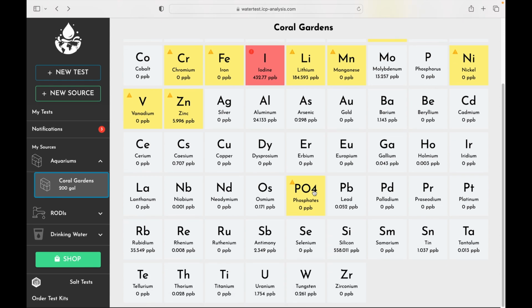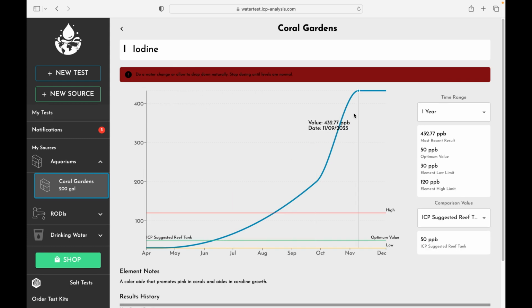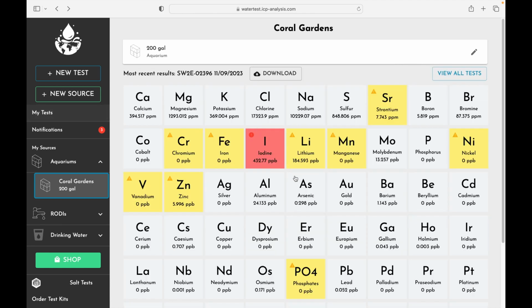So overall, not a bad test, except this iodine here would concern me, and there's something going on here. This is really, really high. The high level is way down here. So this would cause me a lot of concern that there's something really wrong going on with the tank water here. So that's that for this test.